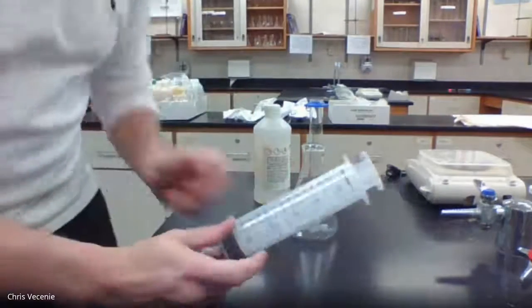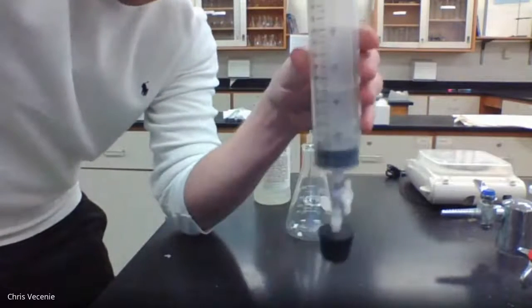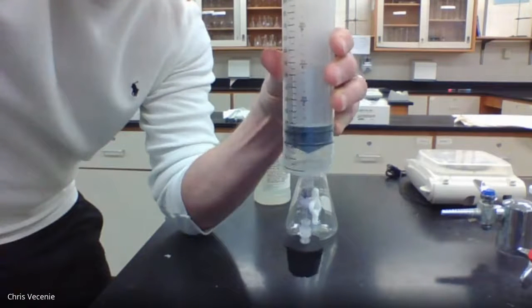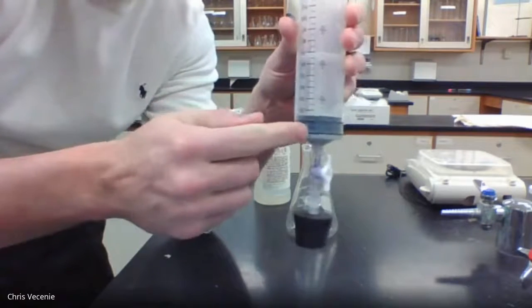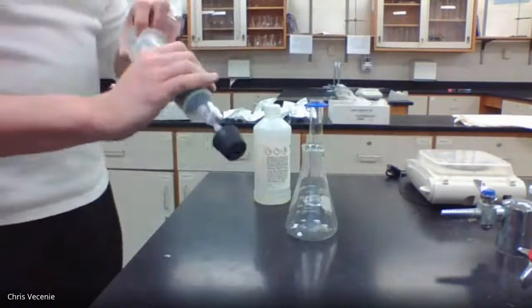I'm going to do it fast, so I won't have time to talk about it. I'm going to plug the top in, and give this a pull and a quick push, just to break the coefficient of friction, so that the gas can start pushing this relatively easily. I don't want it to have to overcome the beginning part where it's sticking. Otherwise, sometimes it stays in the bottom. So I have to do that here.